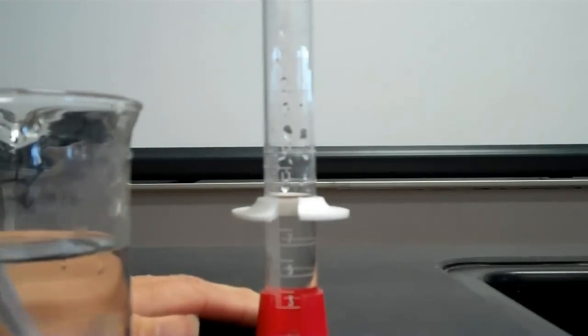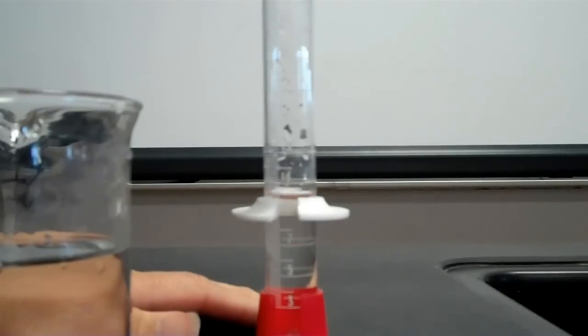Now what I'm going to do is see how many drops does it take to get to 11. And I'm going to start counting. 1, 2, 3, 4, 5, 6, 8, 9, 10, 11, 12. I'm getting pretty close.